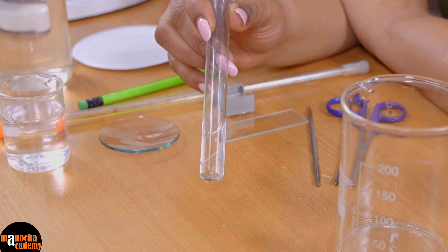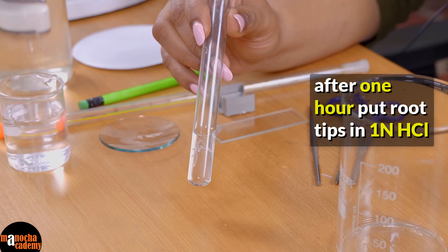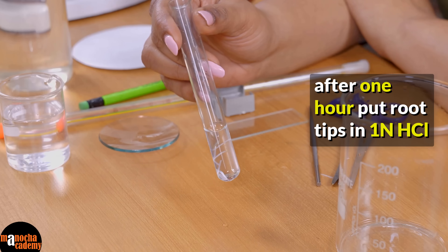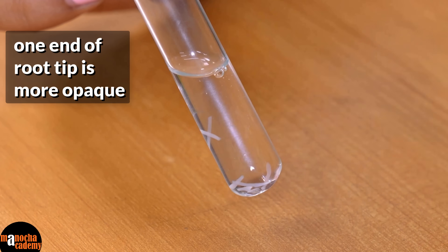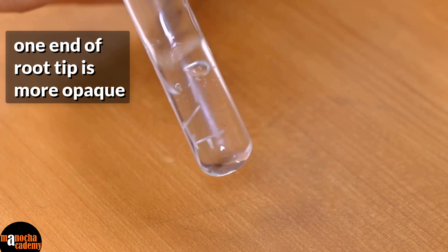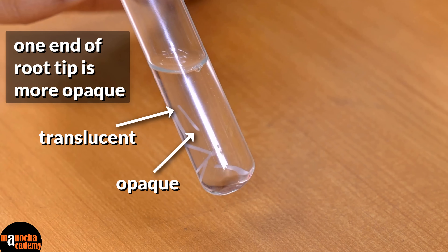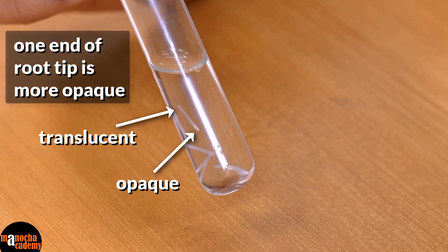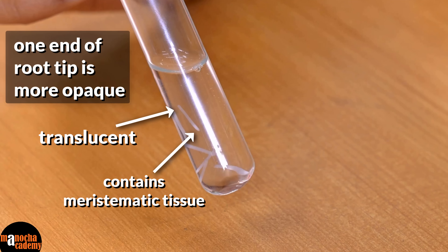Then we put it in 1 normal hydrochloric acid. Now if you look at it closer, you can clearly see a more opaque region and a more transparent region in every section that we have taken. The opaque region is pointed whereas the transparent region is not. The opaque region is where the meristematic tissue is located. This is the part that we want, but we will not cut it off right now.